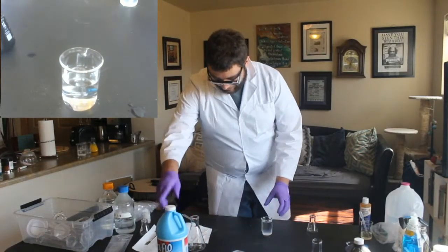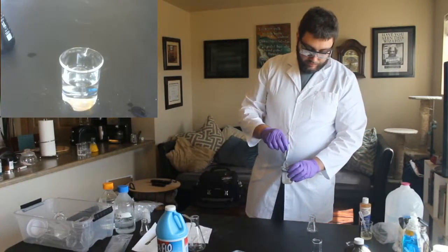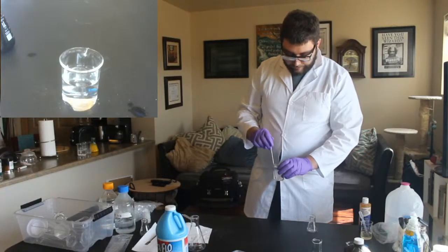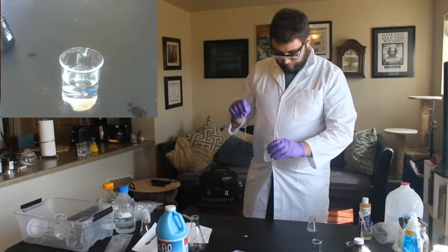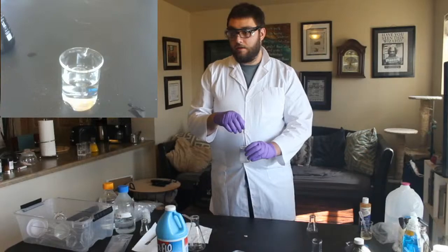Okay, so now I'm going to mix this up. This is our hydrogen peroxide and starch, and then this time we have a... Oh no! What is that? Oh, some foil from our starch container, I think.